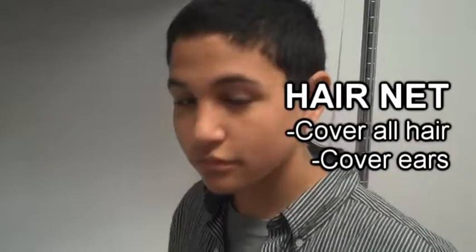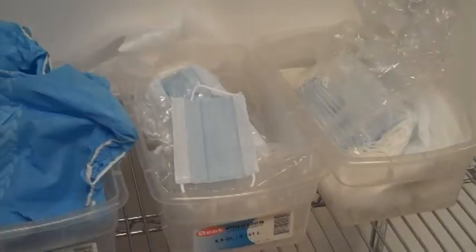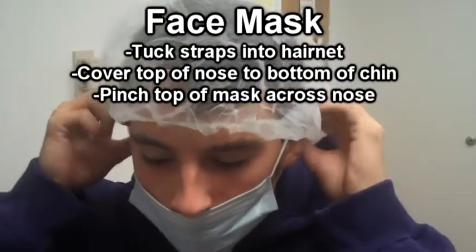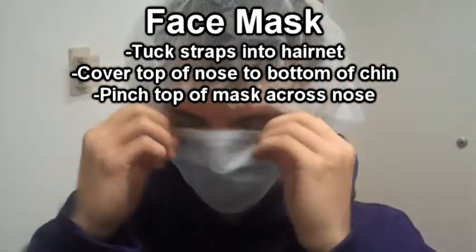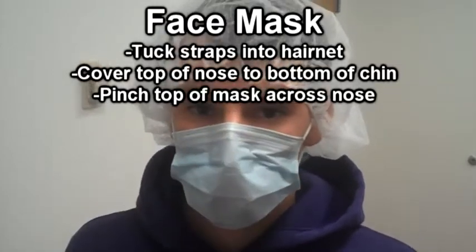Your first step is to put on your hairnet. Make sure it covers all of your hair and also covers your ears. Next, you'll have to put on your face mask. Be sure the straps on the face mask get tucked underneath the hairnet. Make sure your face mask covers from the top of your nose to the bottom of your chin, and be sure to pinch the top of the mask across the nose once it's on.